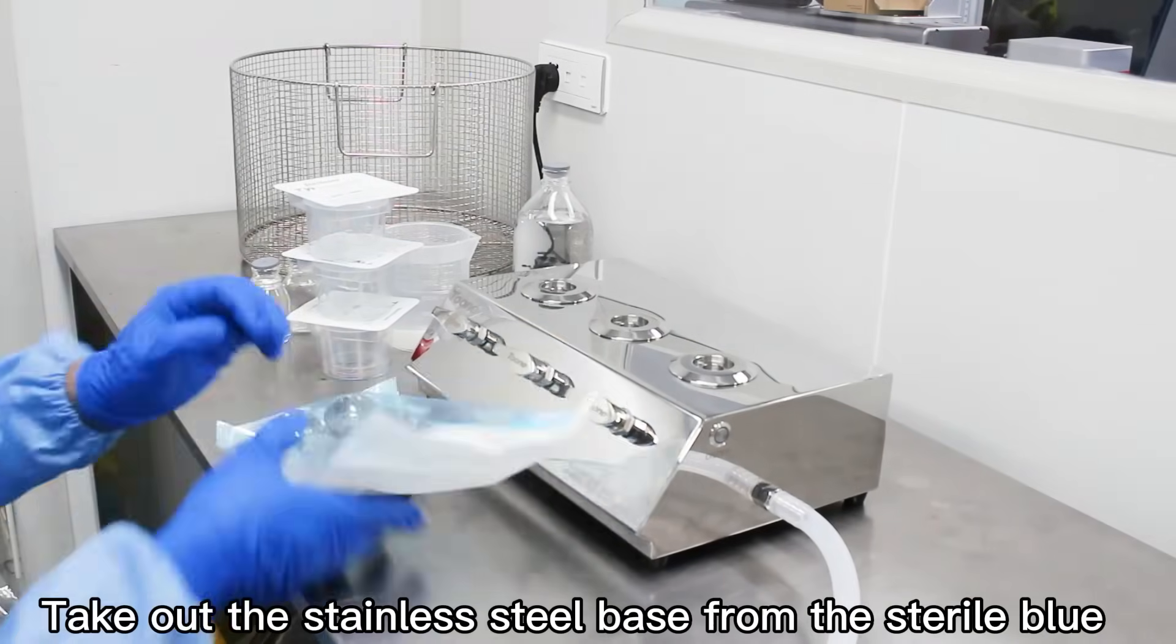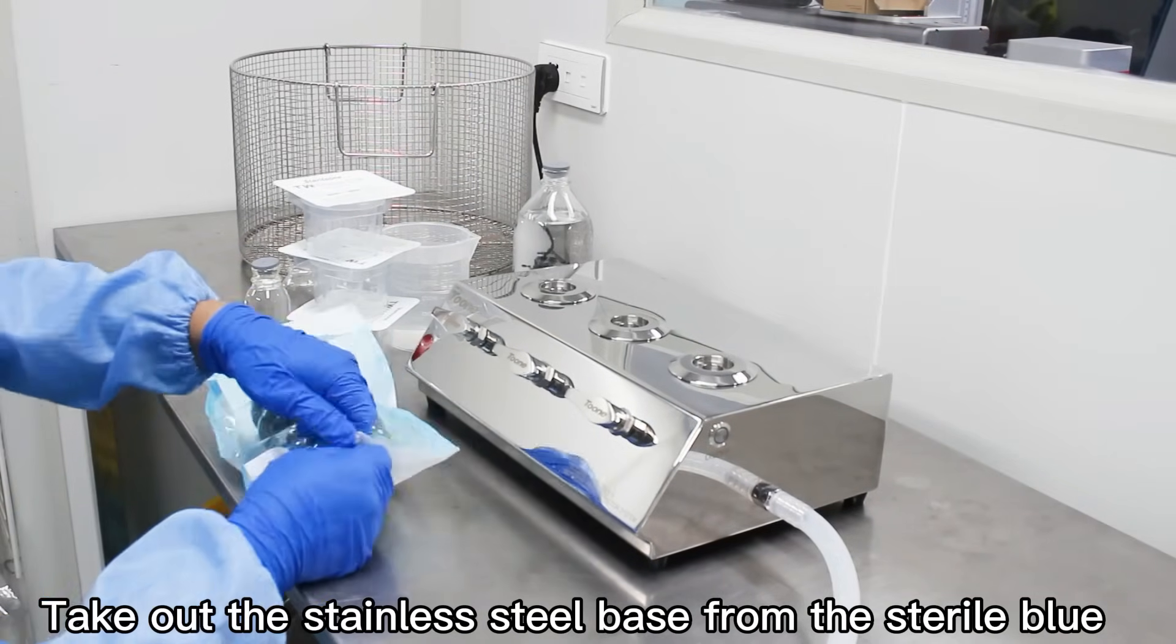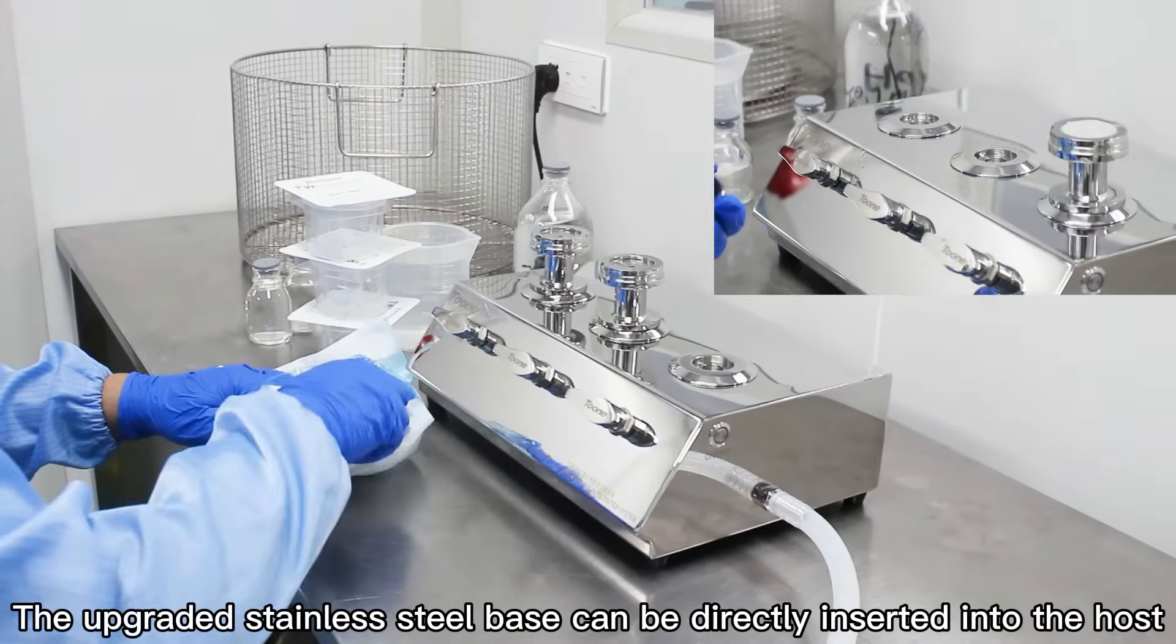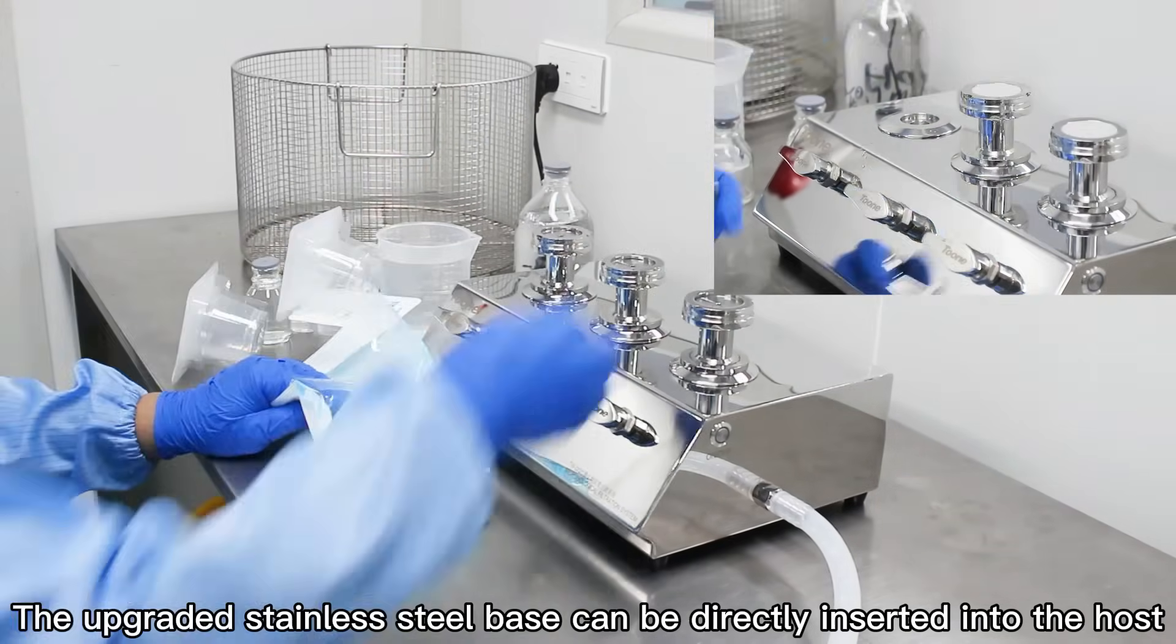Take out the stainless steel base from the sterilization bag. The upgraded stainless steel base can be directly inserted into the host.